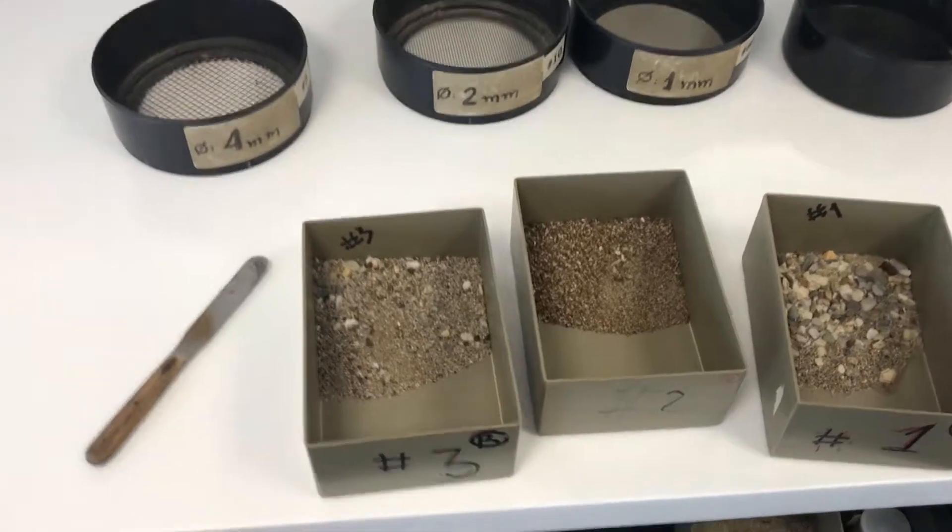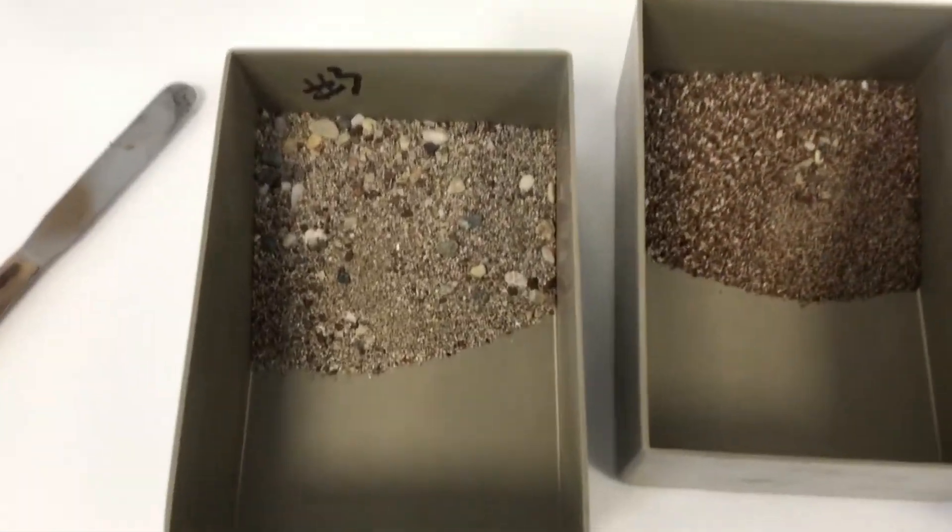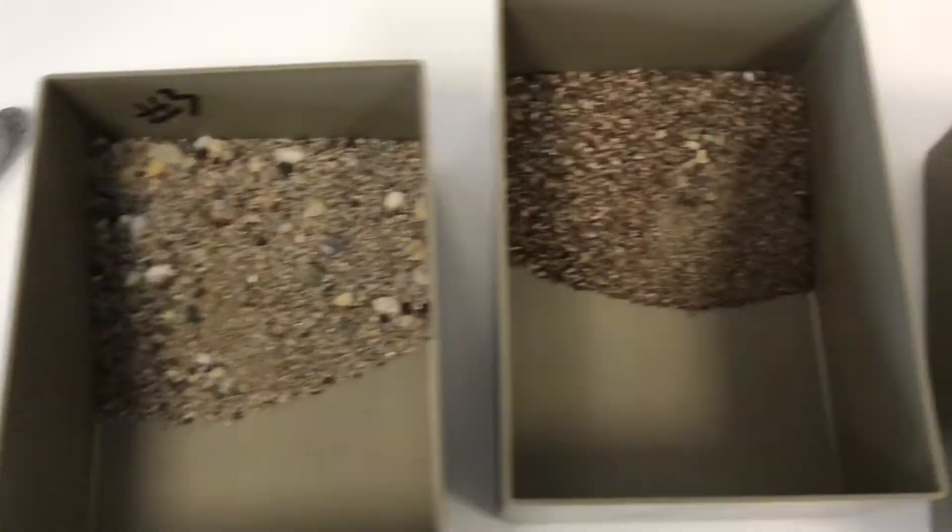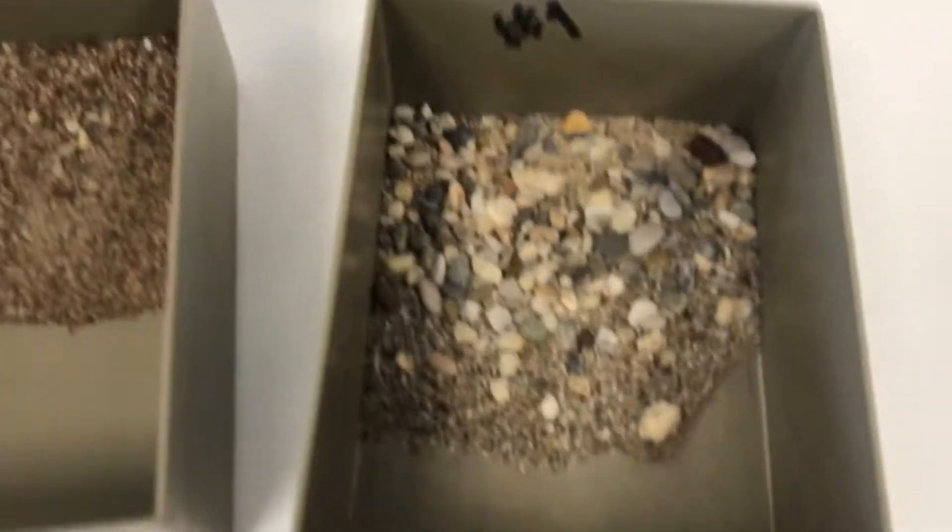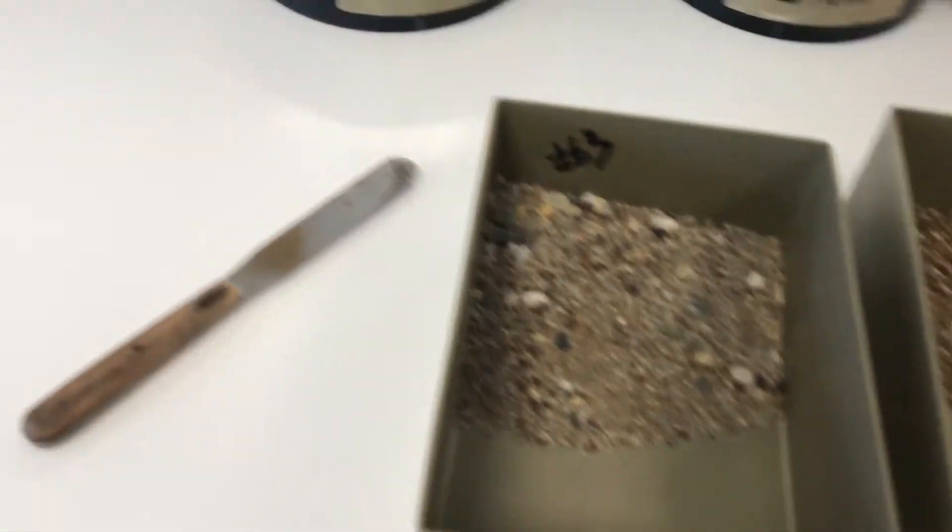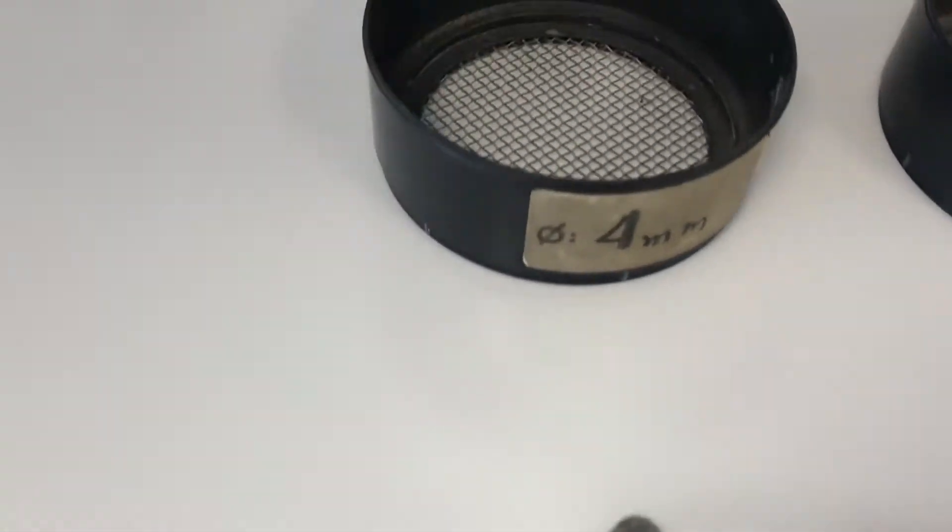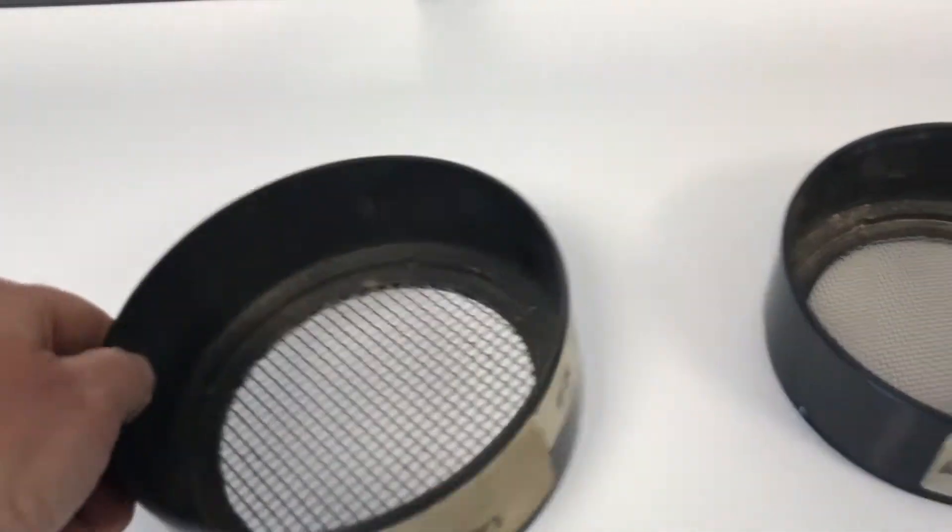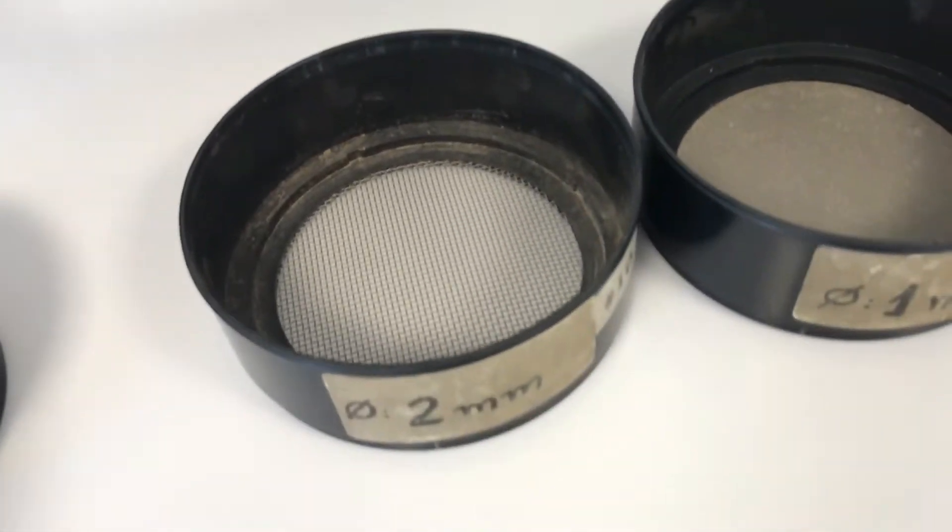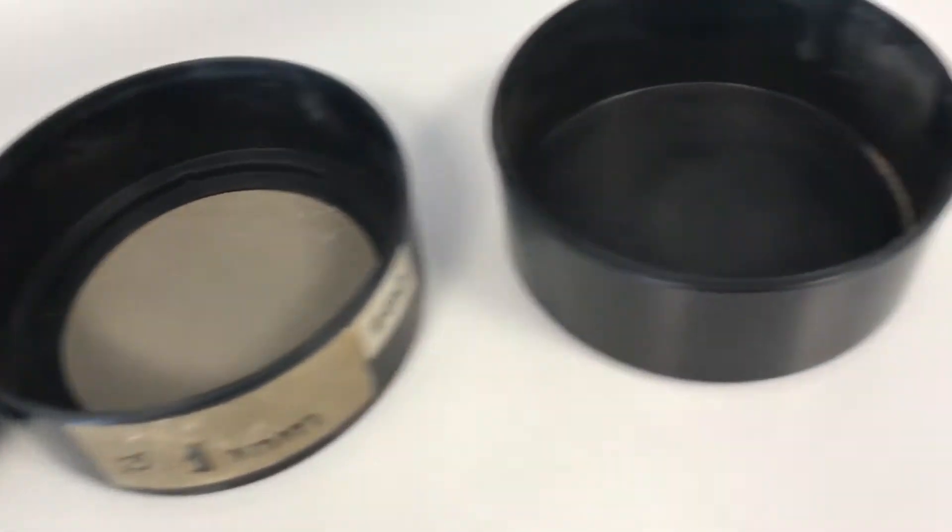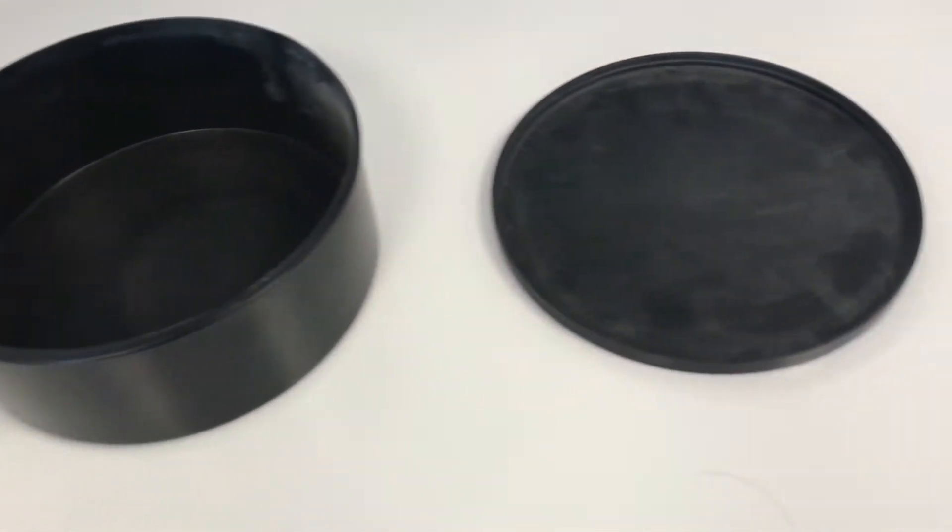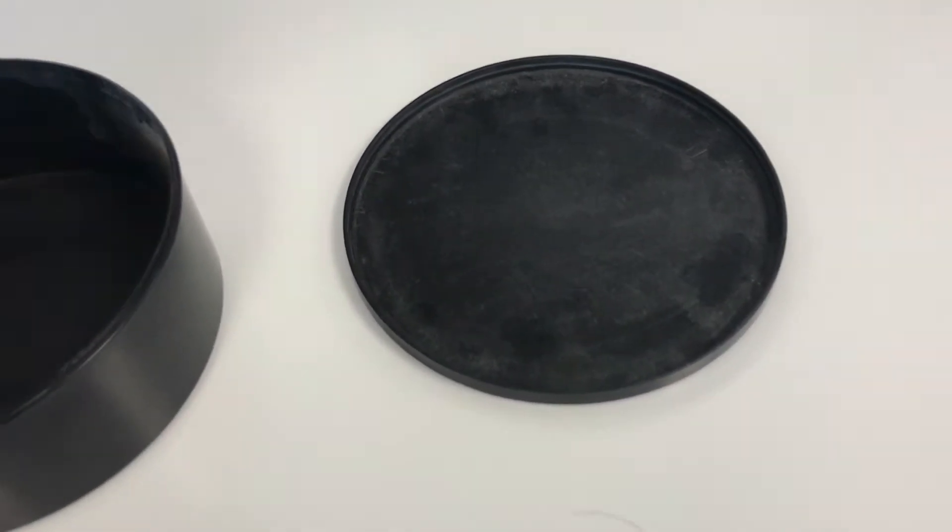Okay, this is the setup of the sedimentary size analysis, and what we see is the samples. Now we see the mesh, just meshes of certain millimeters mesh, and we've got a set from the coarse to the finest.